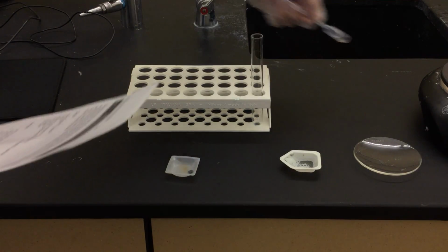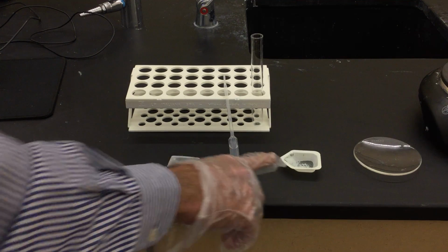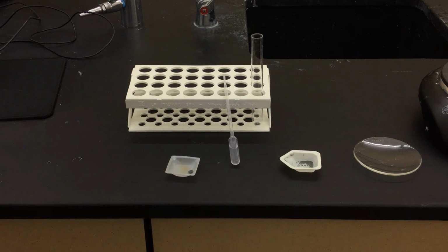So I have some alcohol in this little pipette right here. And then what we're going to do is we're also going to be adding some of the zinc. The zinc, which is the metal, is silvery in color and is added to the alcohol solution. An exothermic reaction occurs releasing some heat, which you will not be able to experience during this lab, and it's going to form a white zinc iodide, which can be obtained by evaporating the alcohol.